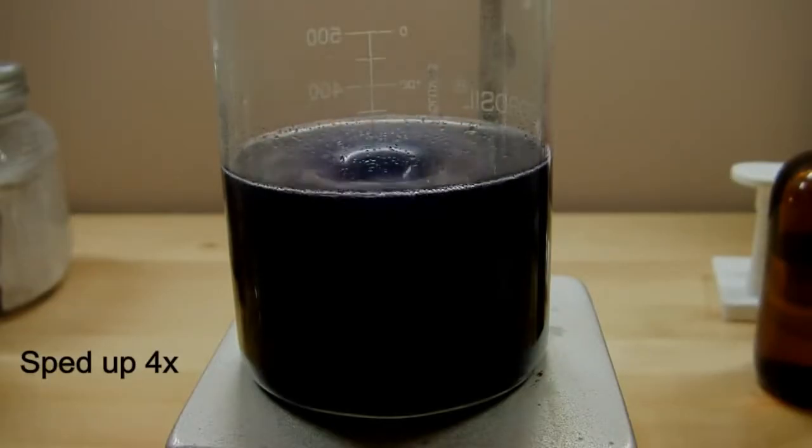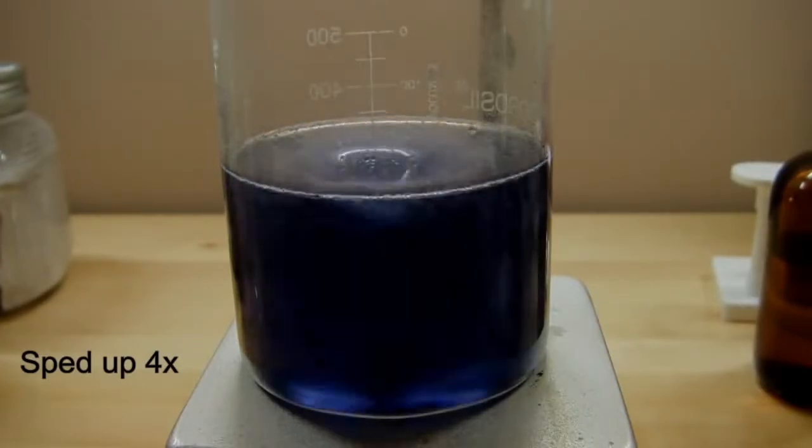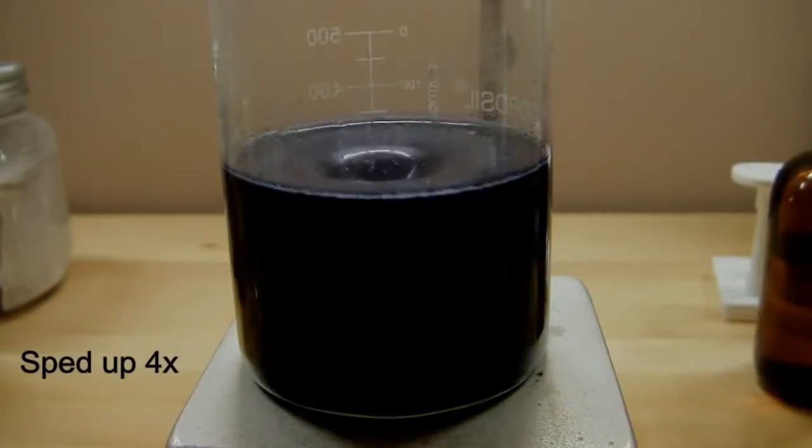So I used 100 milliliters of each of the 3 solutions, and this oscillated for almost 10 minutes. I sped up this part of the footage so you wouldn't have to sit through the whole thing. And you can probably see that the reaction slows down as it proceeds, and it's finished when it remains at this blue stage.